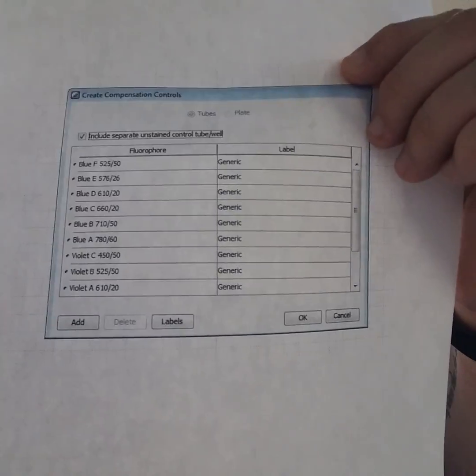So after you've selected create compensation, you're going to get this box up here and at the top there's this checkbox that says, include separate unstained control. Uncheck that box. That way you will not have to collect an unstained sample and the software will not use the unstained sample to collect compensation.